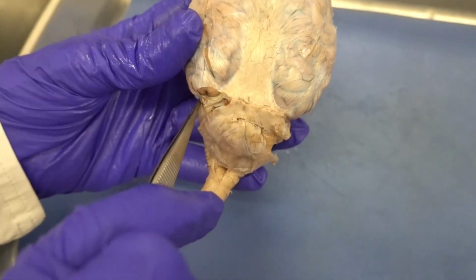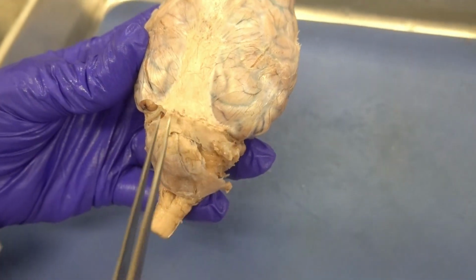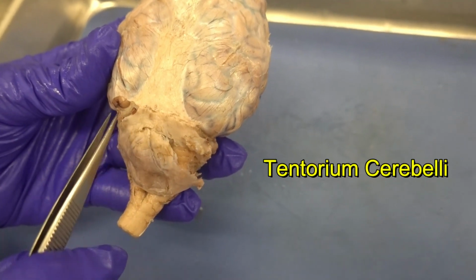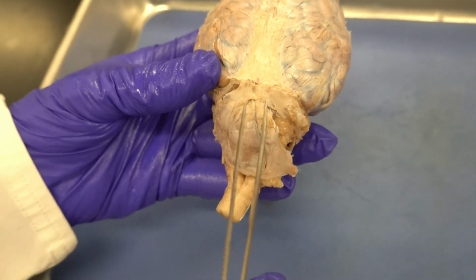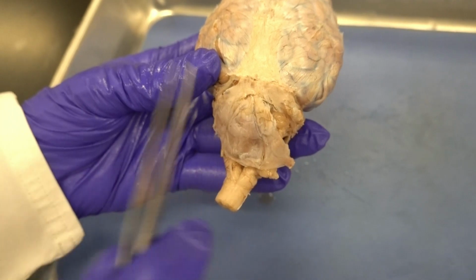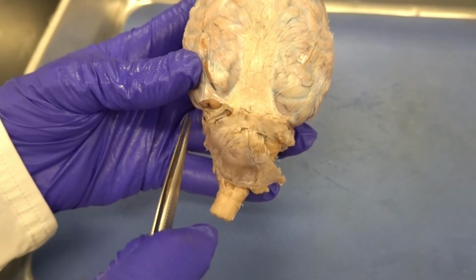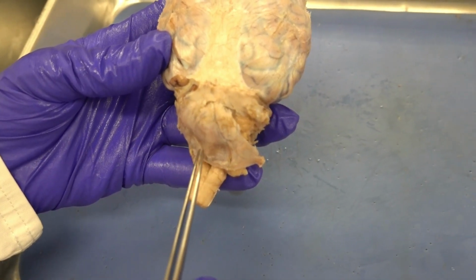We have another part of the dura mater. This one separates the cerebrum from the cerebellum. We name this layer of dura mater that I'm pointing at tentorium cerebelli. Between the two cerebellar hemispheres, we have another part of dura mater that separates the two. We call that falx cerebelli. So: falx cerebri, tentorium cerebelli, and falx cerebelli.